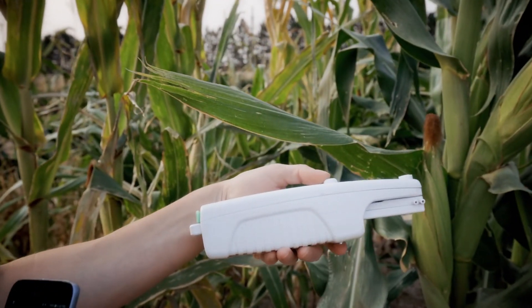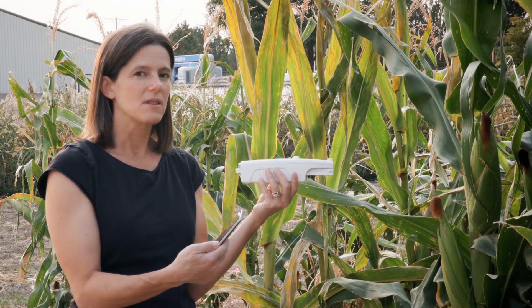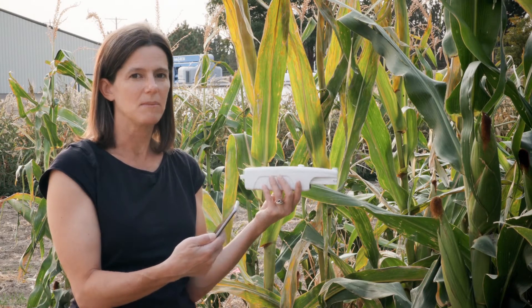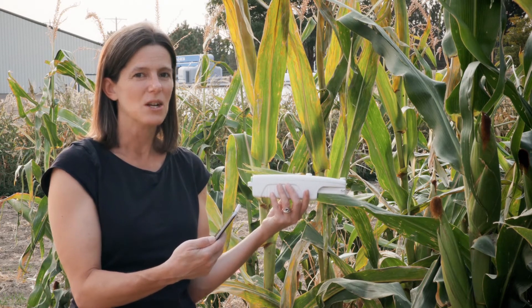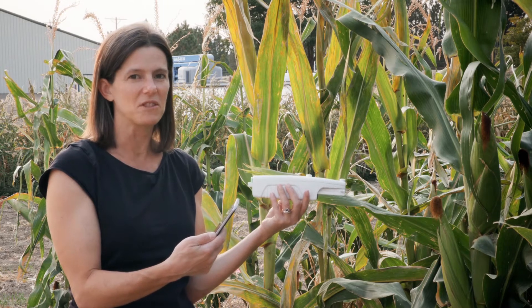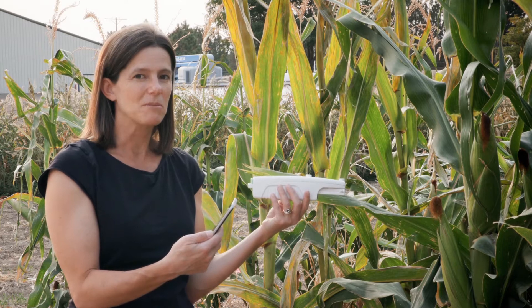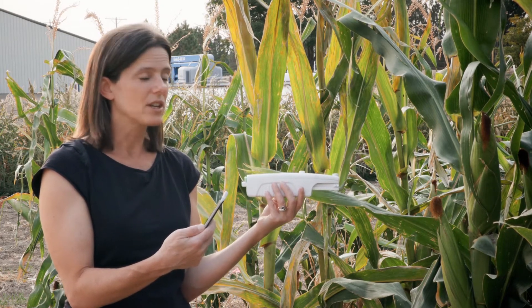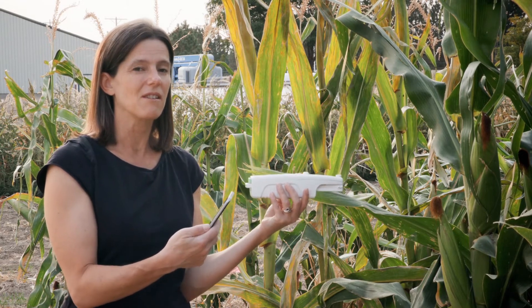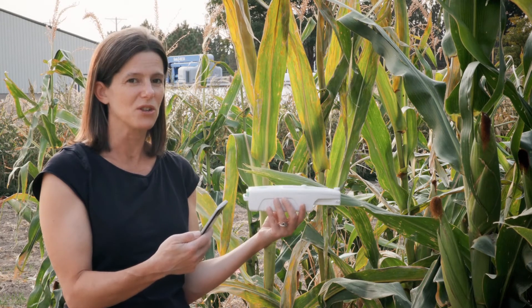This unit I'm holding in my hand is a newer sensor technology that measures proxy measurements for photosynthesis. In my first research job, I measured photosynthesis with an instrument about 15 times this size — an infrared gas analyzer that actually measured the carbon dioxide drawdown of the leaf. It clamped onto the leaf like we're going to here and actually measured the gas exchange and the whole process of photosynthesis.